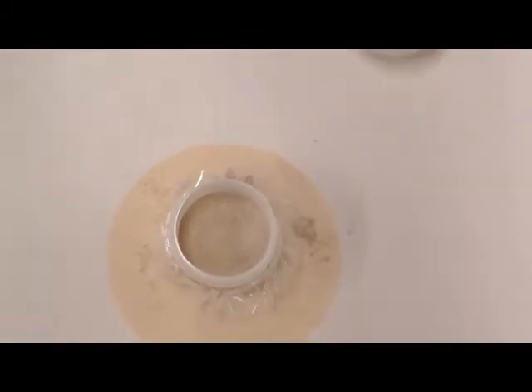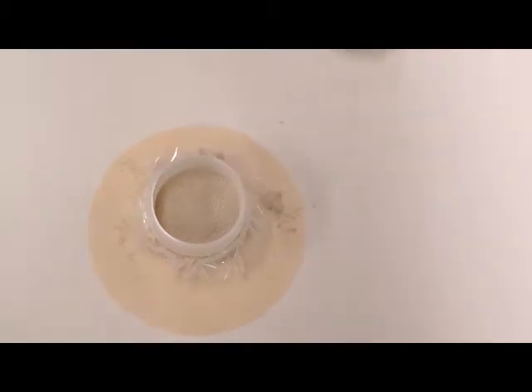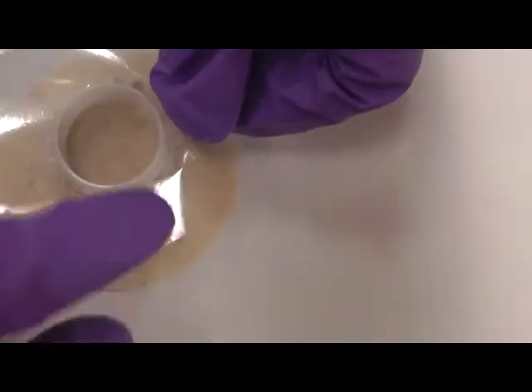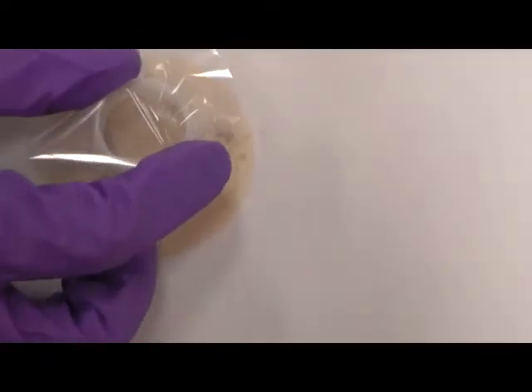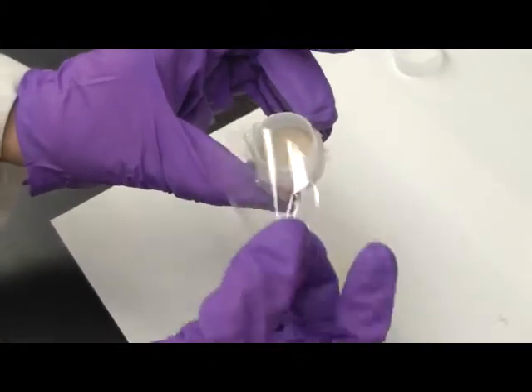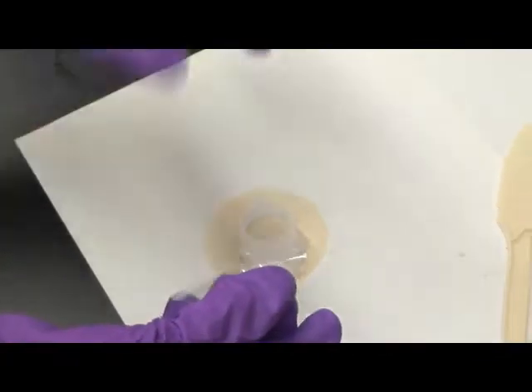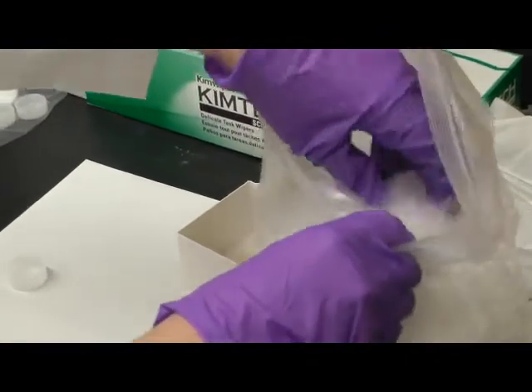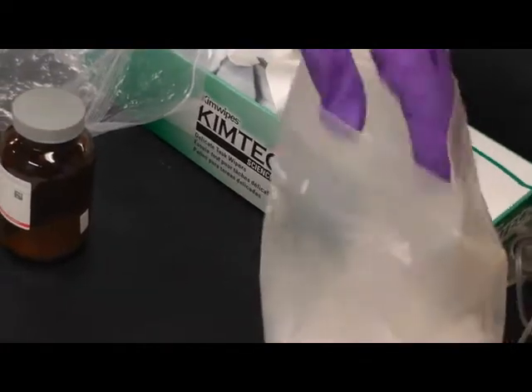Now we put a second thin film on top of the soil. And as you can see there are still some empty space in the cup. And we are going to fill it with polyester fibers. So put on the second film, and then fill the rest of the space with the fiber.